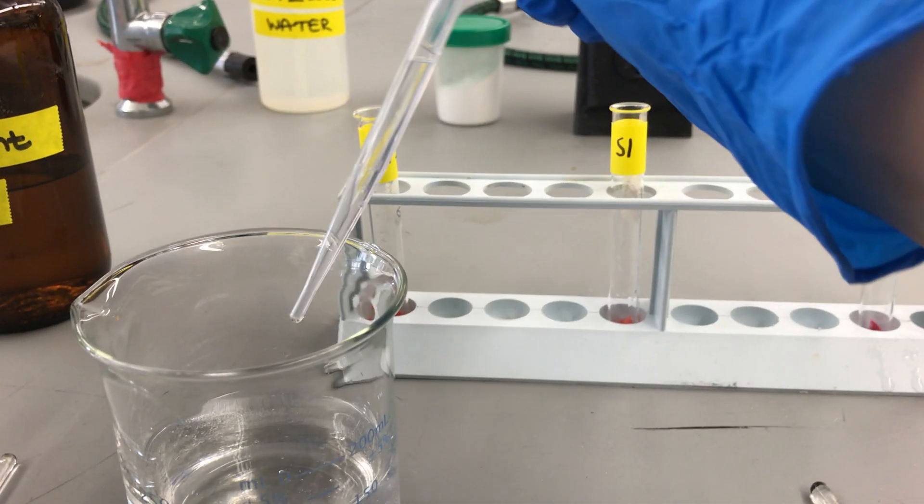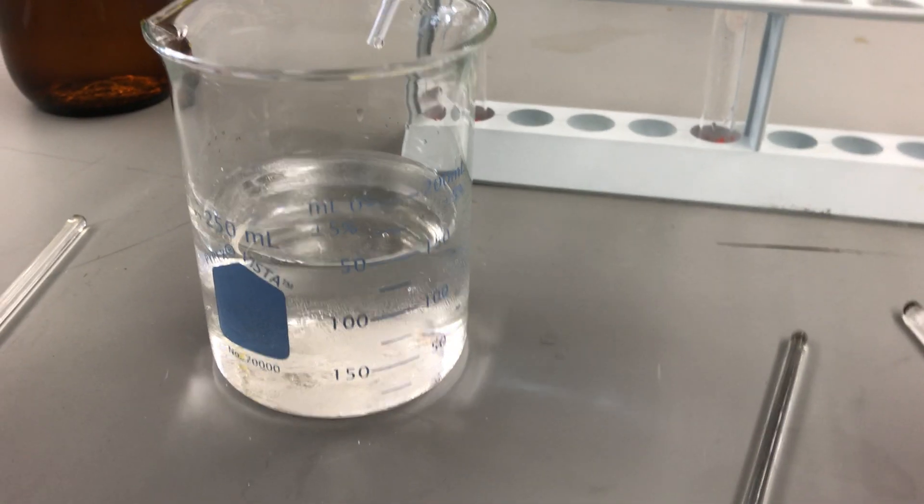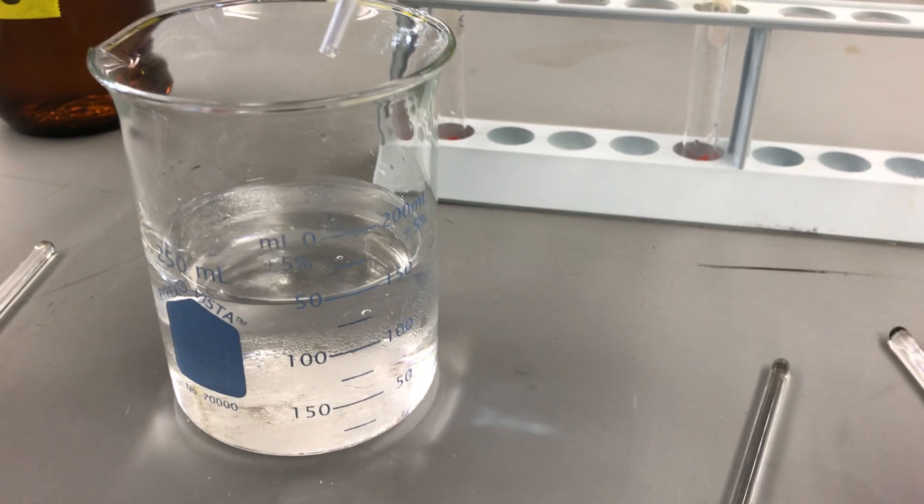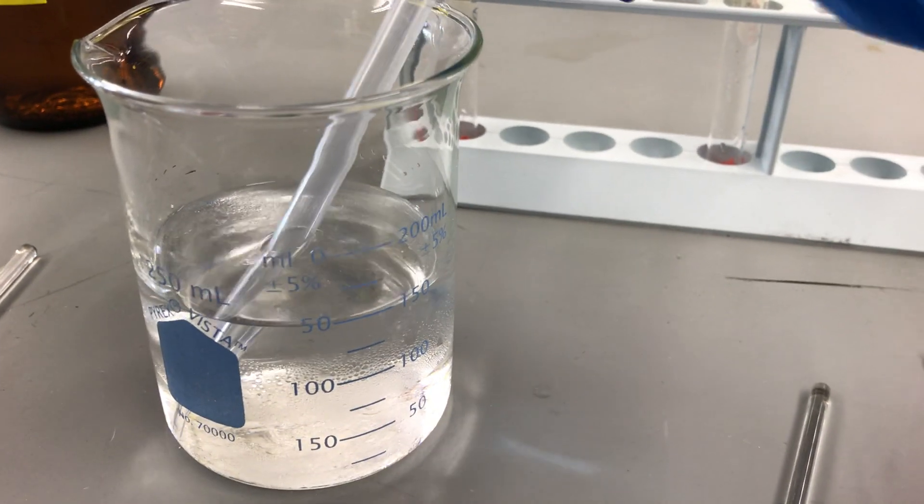All right, let's go. Place the rest back into our beaker so we can dispose of it. Remember, we will not pour the leftover chemicals back into the stock bottle because they're essentially contaminated by the glassware and by using the pipette.